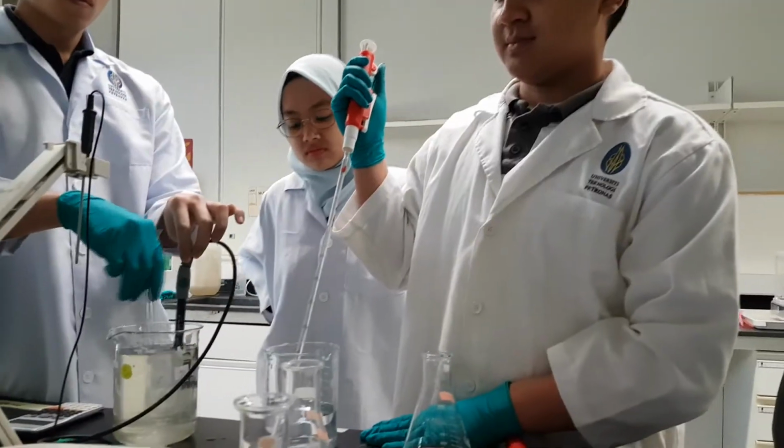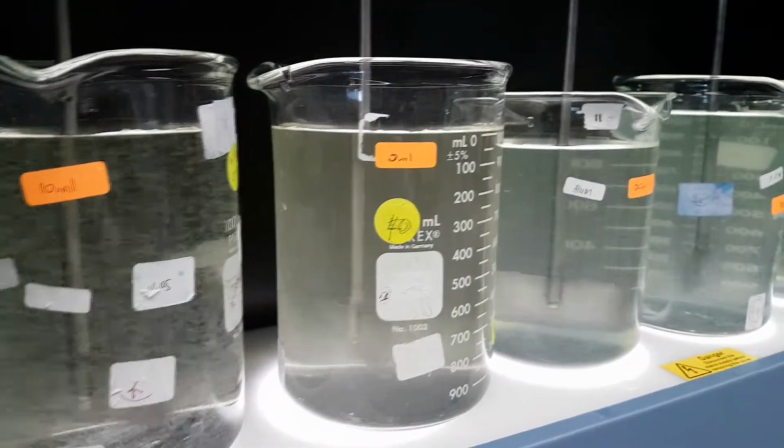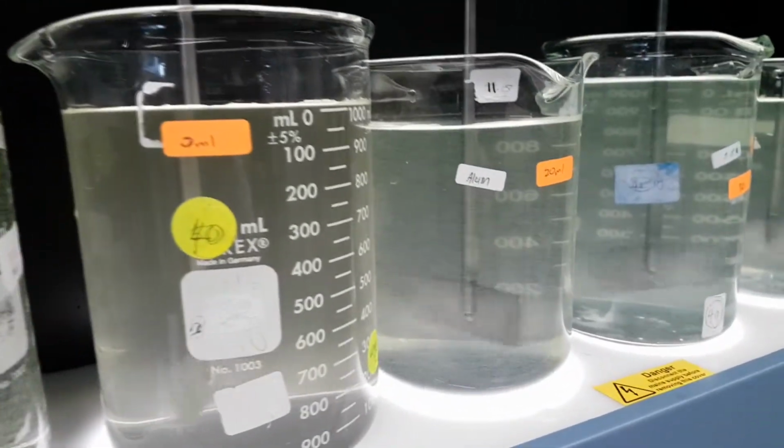Experiment about coagulation and water hardness. In this experiment, a common wastewater monitoring test is coagulation, flocculation, and water hardness. Our objective is to illustrate the difficulties we face when carrying out this experiment, to familiarize ourselves with the procedure of monitoring tests, and also to illustrate the principles of coagulation and water hardness.